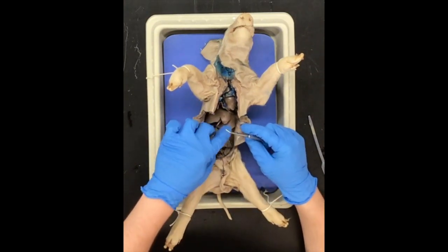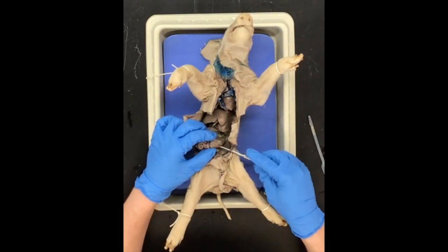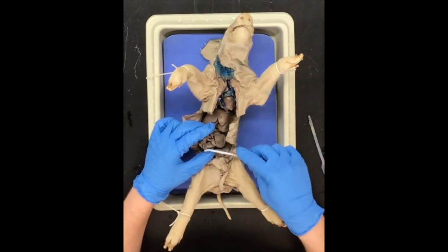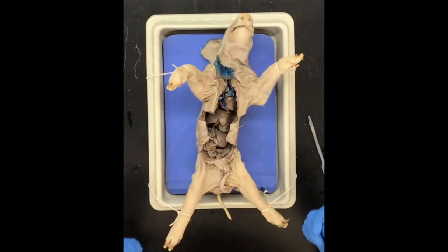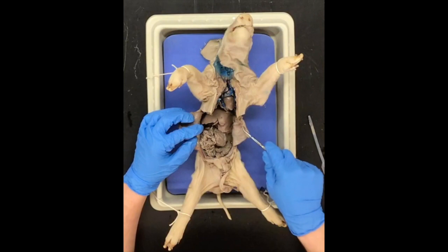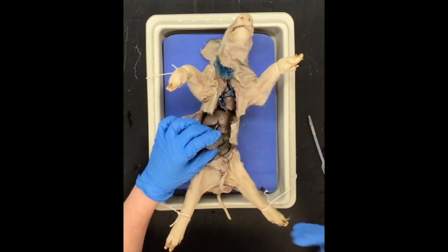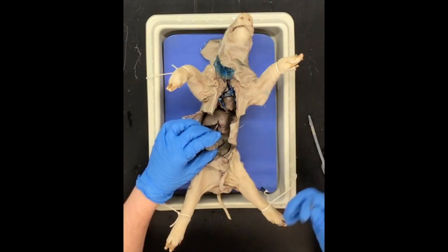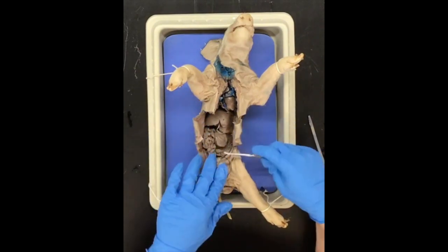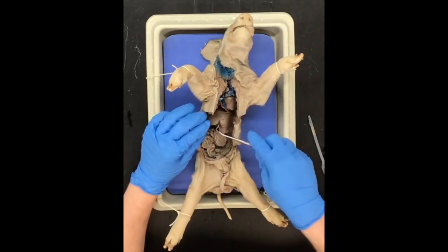As we continue on, you see towards the end of the small intestine is the large intestine — it's a little bit thicker in size. The small intestine really serves the purpose of absorbing all of the nutrients from our food. Once it gets to the large intestine, all that's really left to absorb is water. So the large intestine absorbs water into the bloodstream, the blood circulates the water around our body, and then eventually we get rid of whatever's left — all the waste.